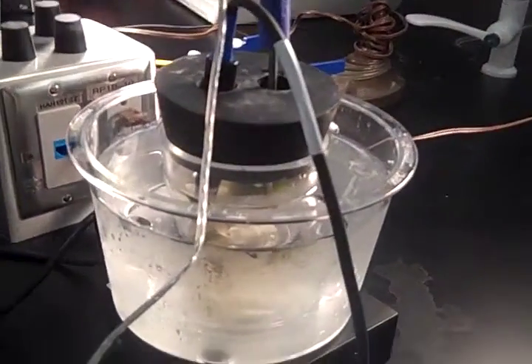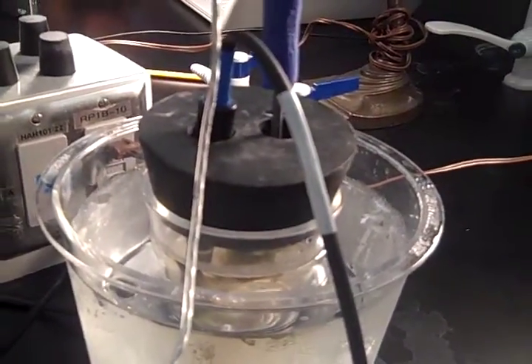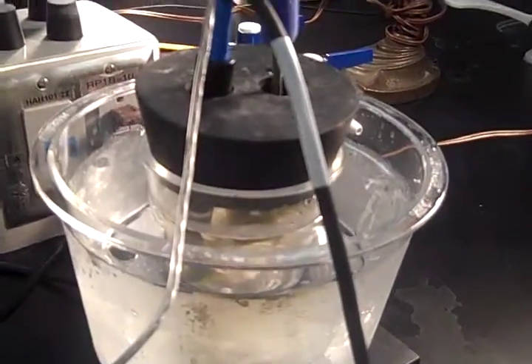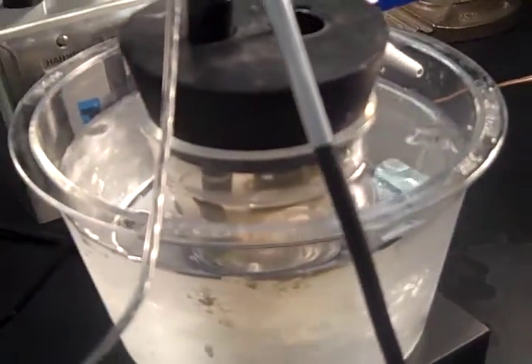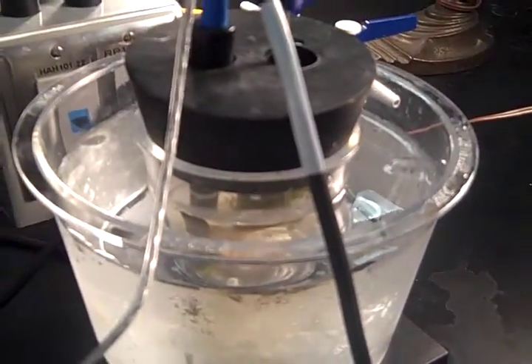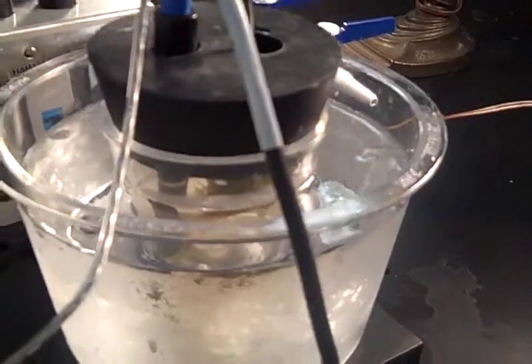And today in this lab, we are going to see what factors can affect the rate of oxygen production in photosynthesis. And this is our lab. Photosynthesis is when carbon dioxide and water plus sunlight react to create oxygen, which is what we and other animals need to live. And plants. And you can see the plant, it's inside right there.